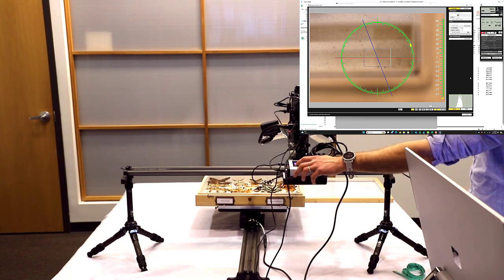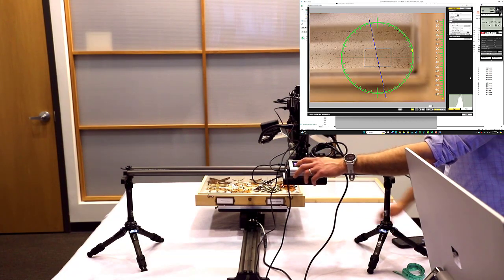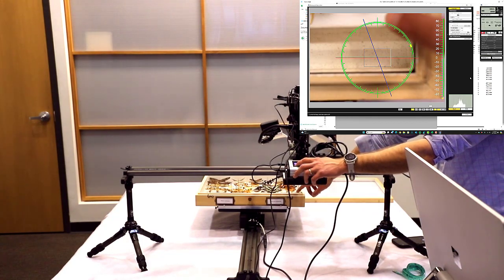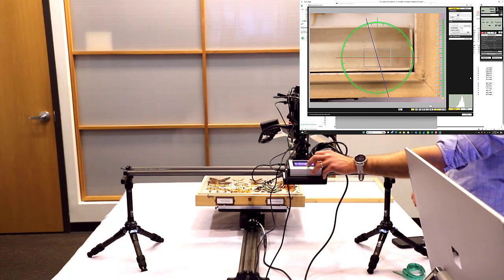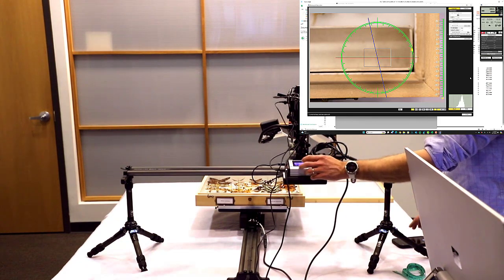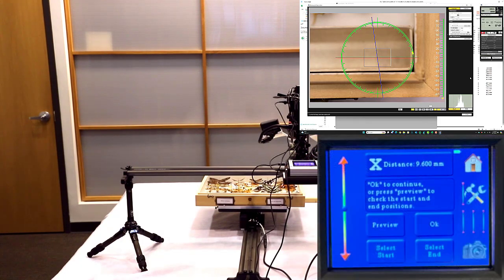and we're going to press the down arrow, and we're going to raise the camera so that the focal plane is at the very top of all these pins that you see. Here there's actually a box. This box is actually above the height of all of our butterflies, so we're going to focus right up at the top there. Actually, I just snapped the picture while I said what I was doing. Sorry, I'm going to hit select end. So now that's all of our axes completely set up.